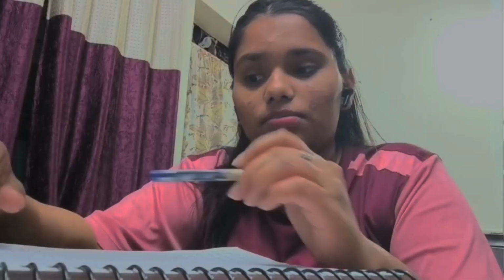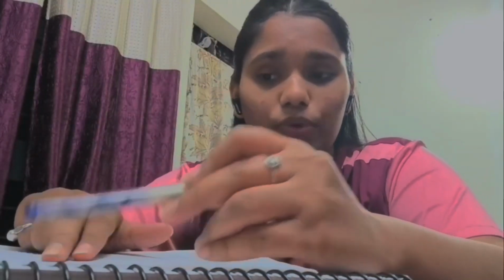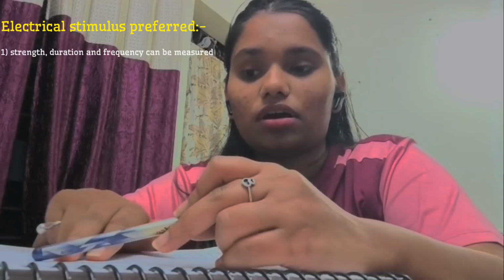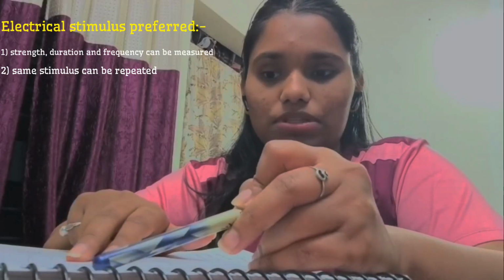I cannot measure the strength, and I cannot ensure that the same strength can be applied again and again by me. It can vary with the amount of fatigue in my muscle. So electrical stimulus is very much preferred because the duration, strength, and frequency can be controlled with an electrical stimulus. It can be repeated with the same strength and frequency.